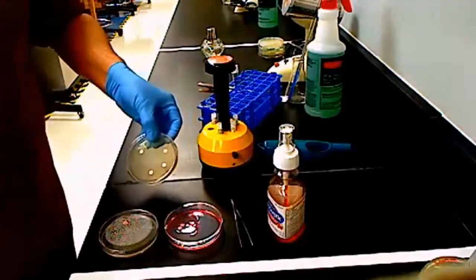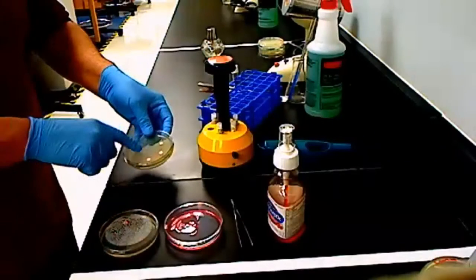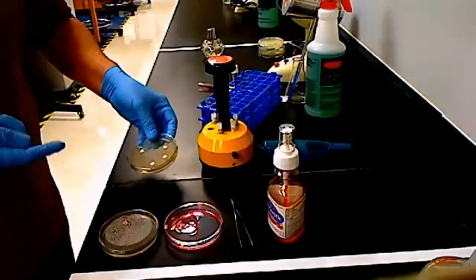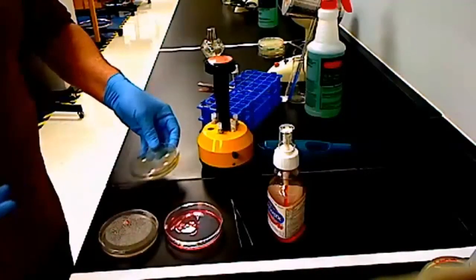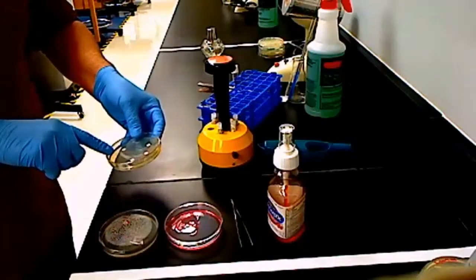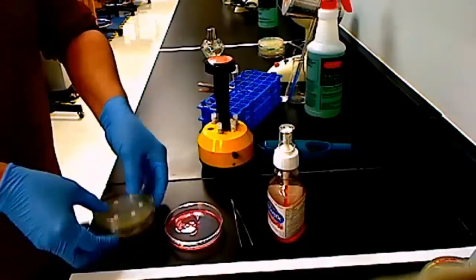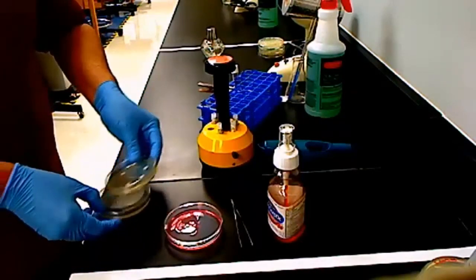Now you can see that there are 4 discs on this plate right here. So this should go a lot faster. You're going to have to do this for each of your microbes. So you have 3 plates. You'll have to do this 3 times. Okay, and once again, with these discs here, whenever you put these Petri dishes on the pink tray, you will put them label side down so that they don't come off. Okay? So this should actually be a fairly quick part of your experiment.